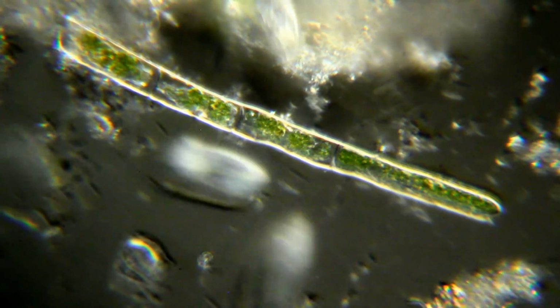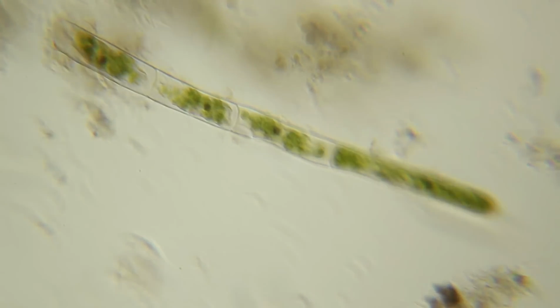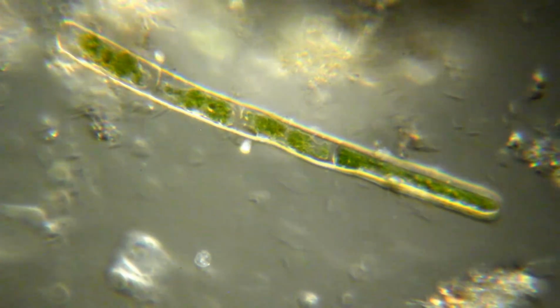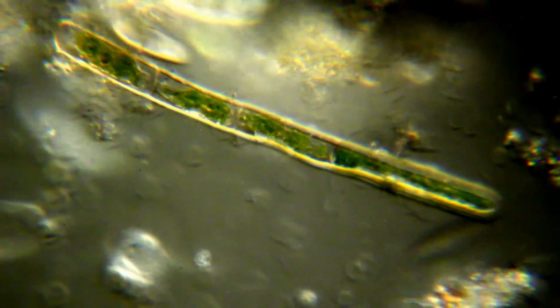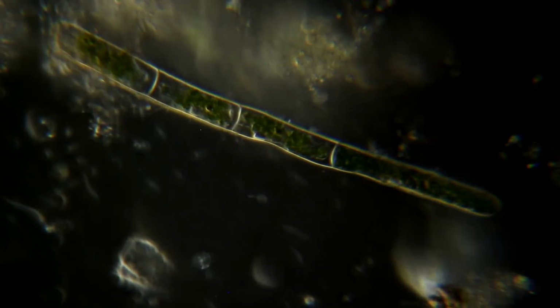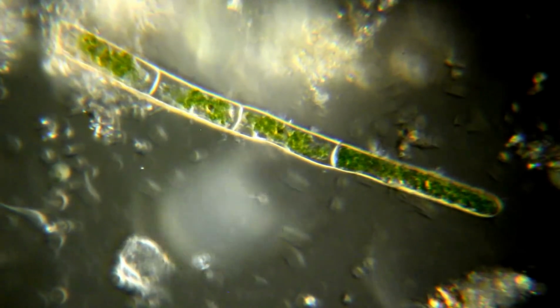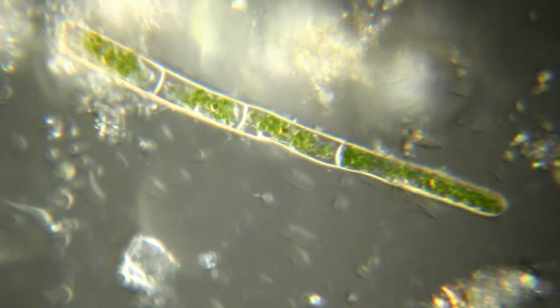So I'm kind of right near the dark field position on the turret. Let me put it right on there. This is right on the dark field position here, and I get the best effects if I move it just slightly off the dark field position and not right on it, even though the turret is, I believe, centered pretty well.